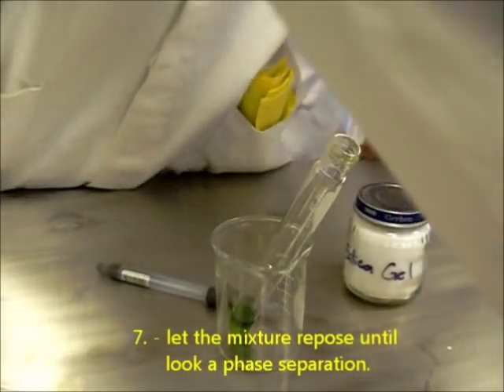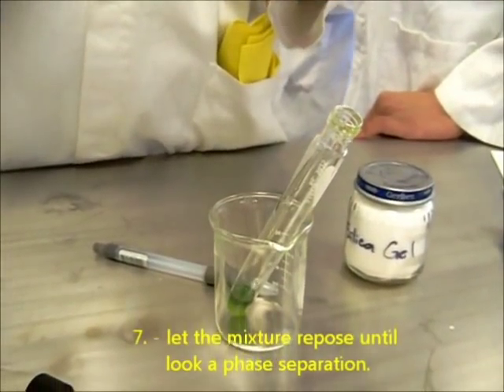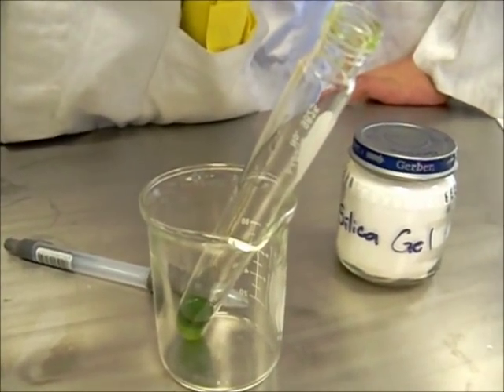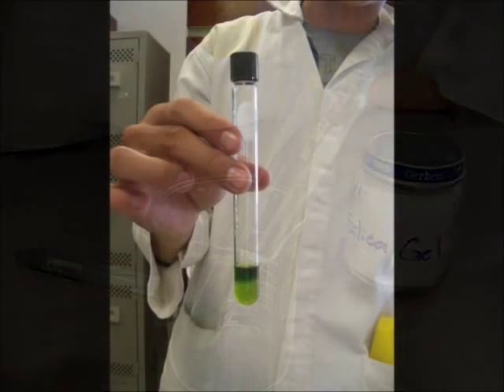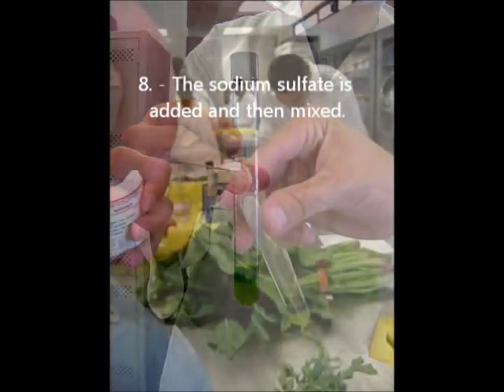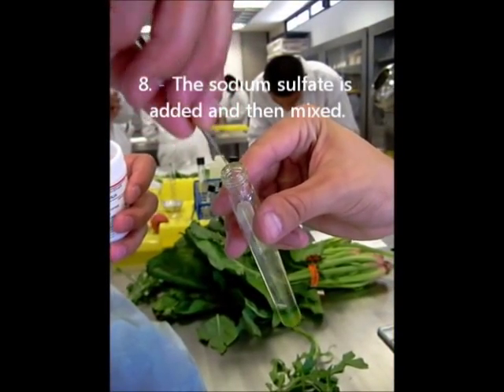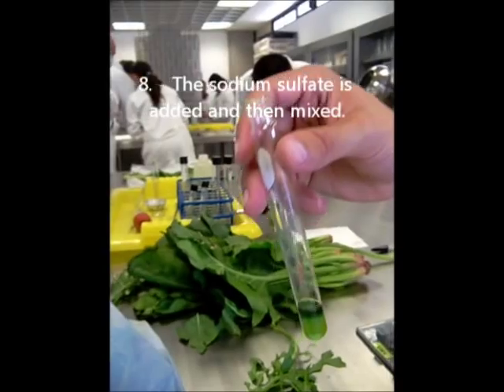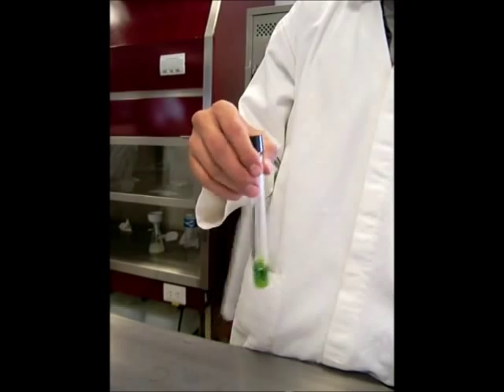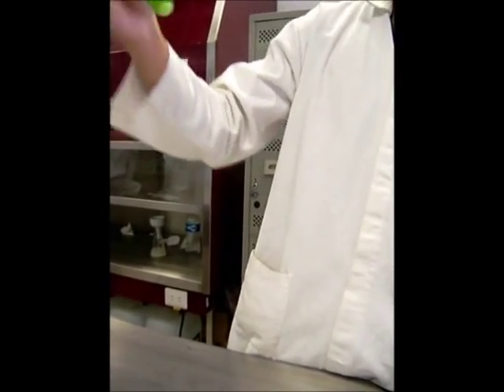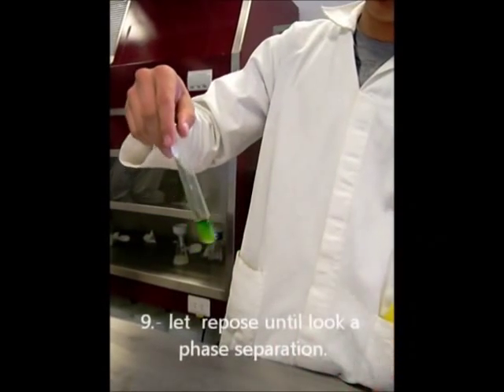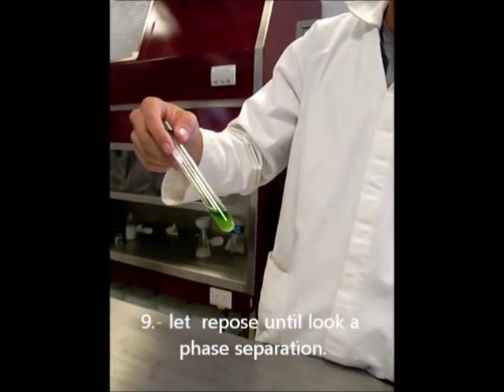Let the mixture repose until it shows a phase separation. The sodium sulfate is added in the mix. Let repose until it shows a phase separation.